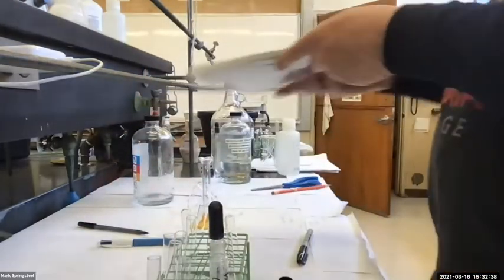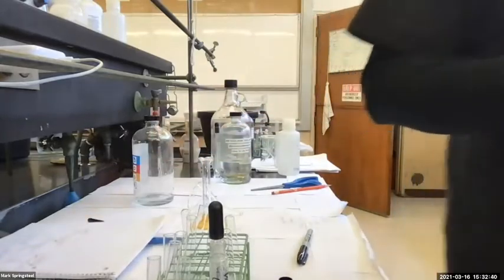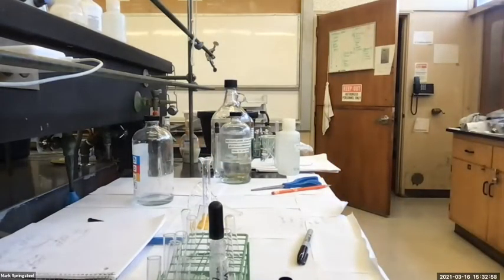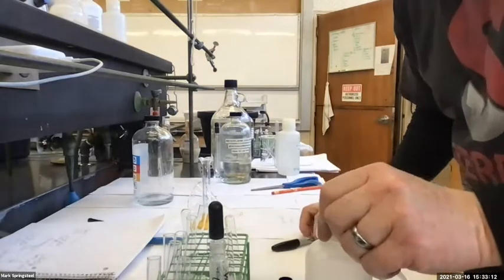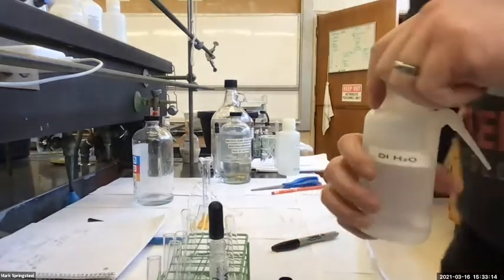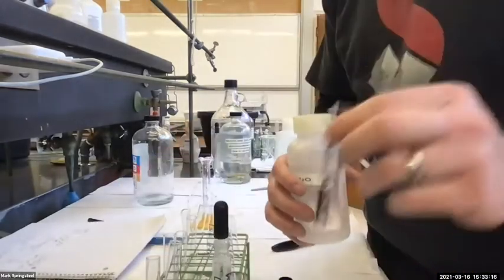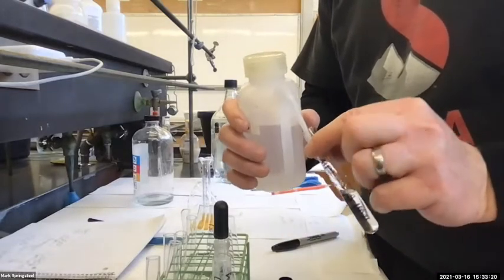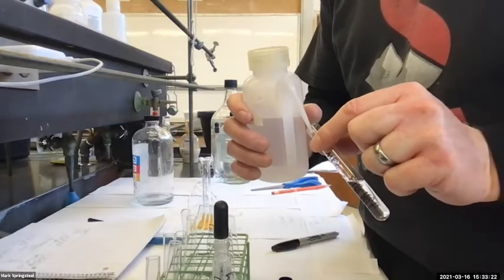But I want to do something that I always want you to do, and I need a water bottle to do it. I'm going to put DI water in the water bottle, just because I was lazy before, but I don't even think it matters much. There we go. So this DI water, I'll use this to test to make sure this is the aqueous layer. If this is the aqueous layer, when I add the DI water, should it create two layers or dissolve?